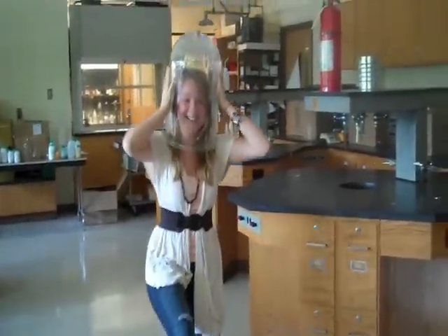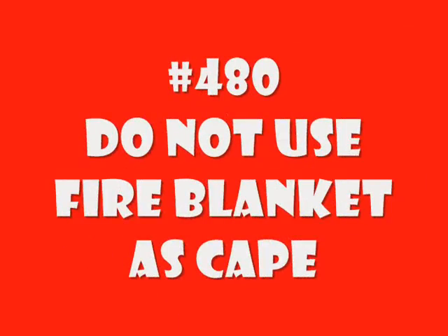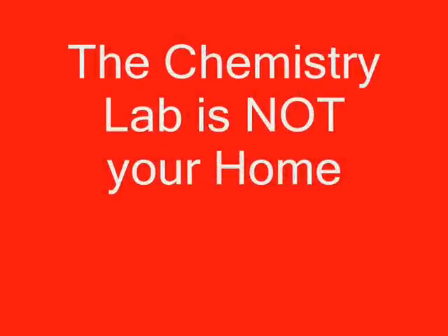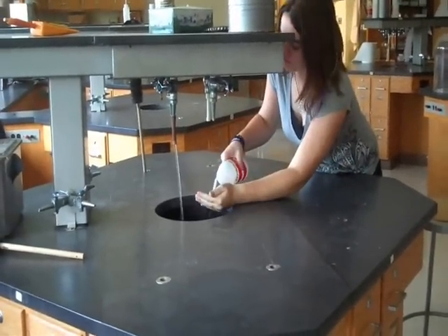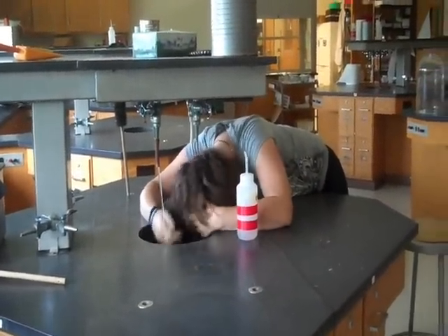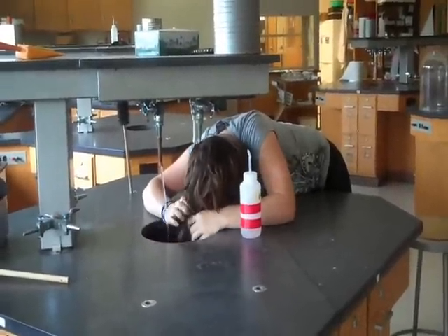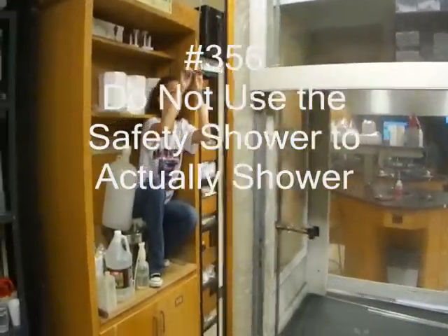One small step for man, one giant leap for mankind. Rule number 102: do not use the chemistry lab sink to wash your hair. Rule number 356: do not use the lab shower as an actual shower.